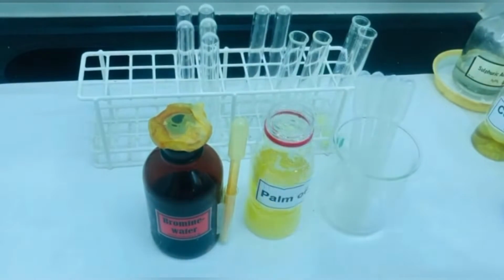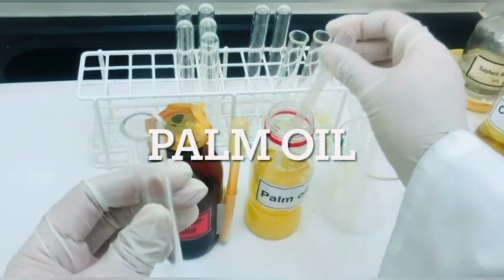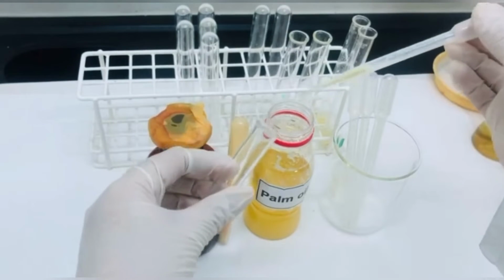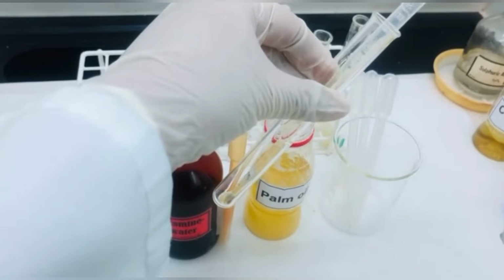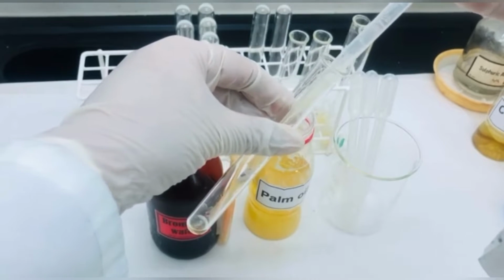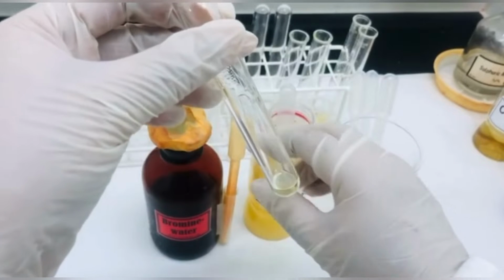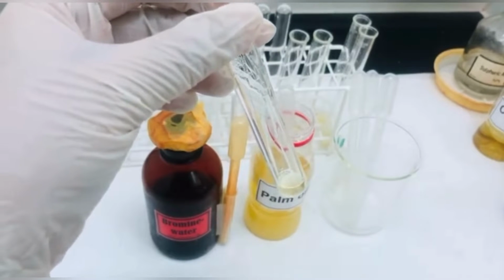The sample that we are using now is palm oil, and we will take 1 ml of palm oil in the test tube. To this palm oil, again we are going to add a few drops of bromine water.